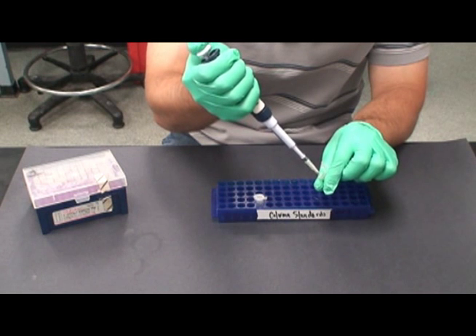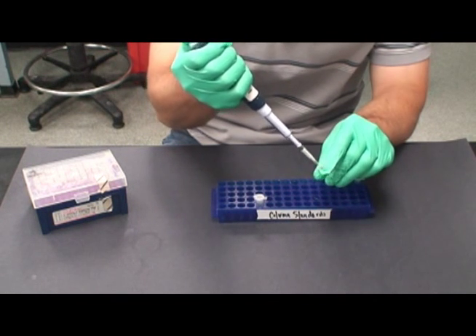Mix both tubes gently by flushing the contents of the tubes up and down a sterile pipette tip.